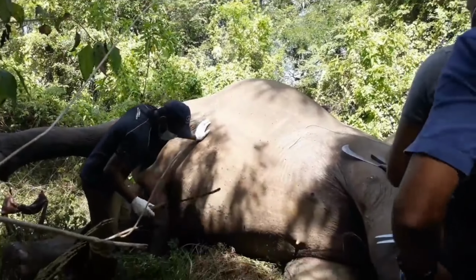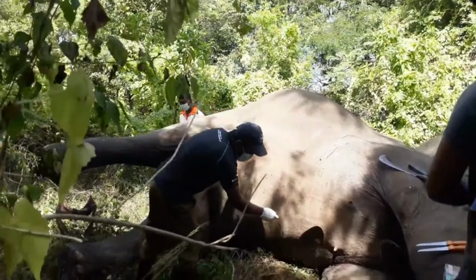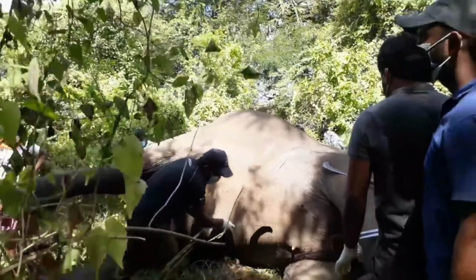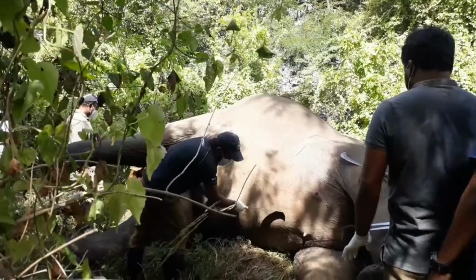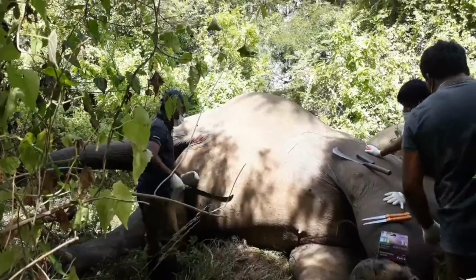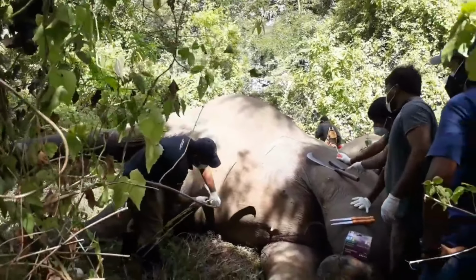Please note that this video involves a detailed internal investigation to determine the cause of death. If you're uncomfortable with graphic content, you may want to skip this one. However, for those interested in learning more about postmortem procedures, stay with us as we work through the case.